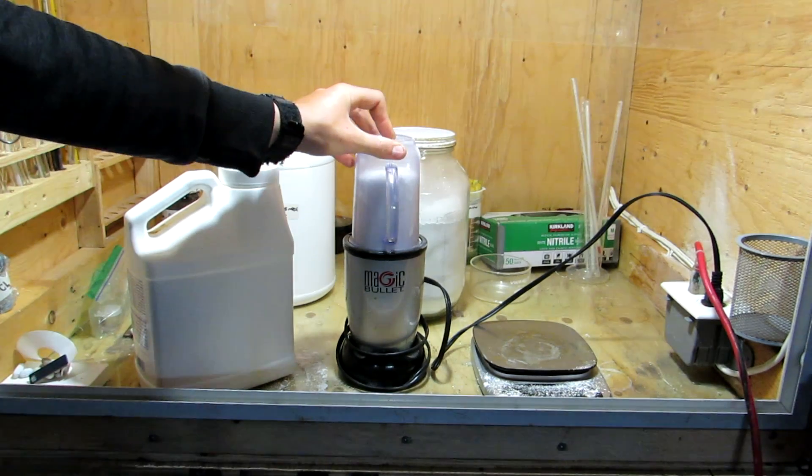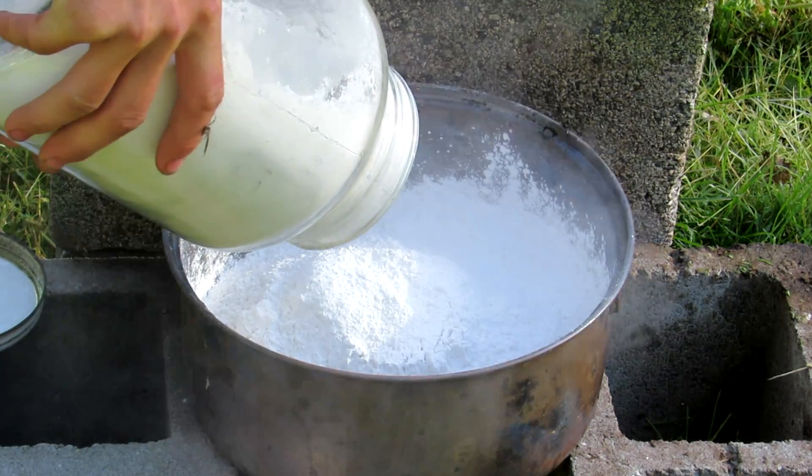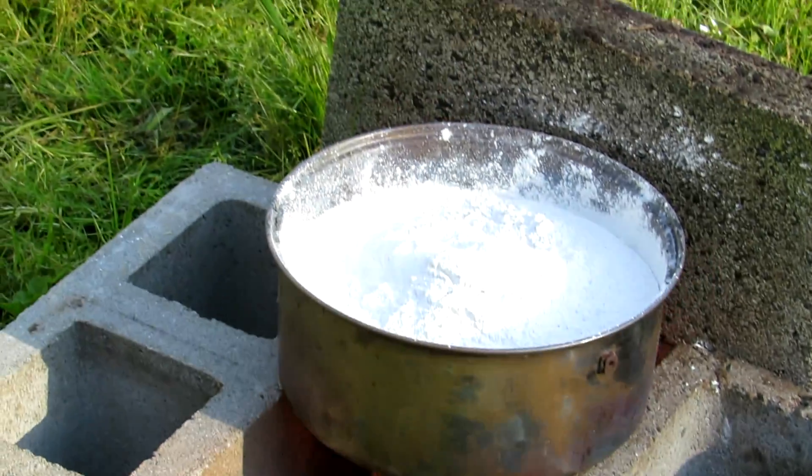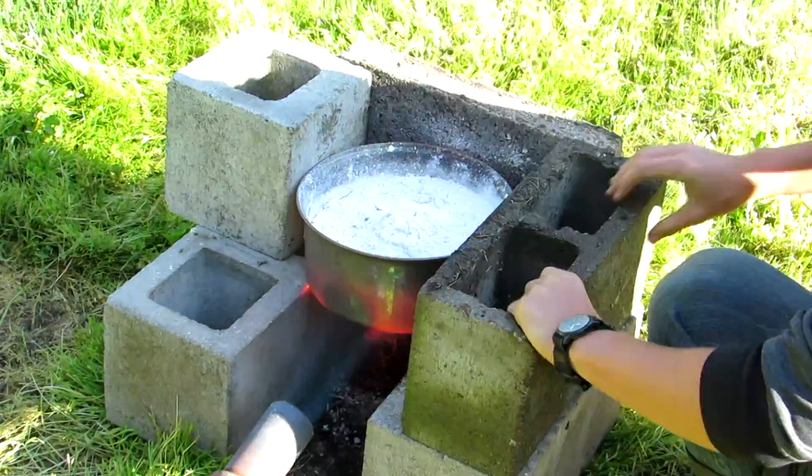The sodium hydroxide pellets were ground into a powder and then everything was added to a large pickle jar to shake and thoroughly mix the two powders. The powders were added to a large steel pot and it was placed under a large propane torch to fully melt and react.